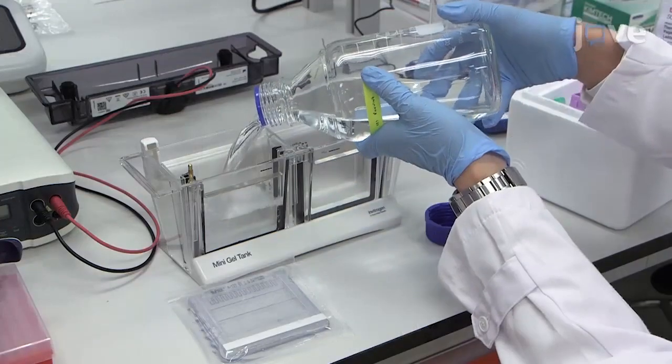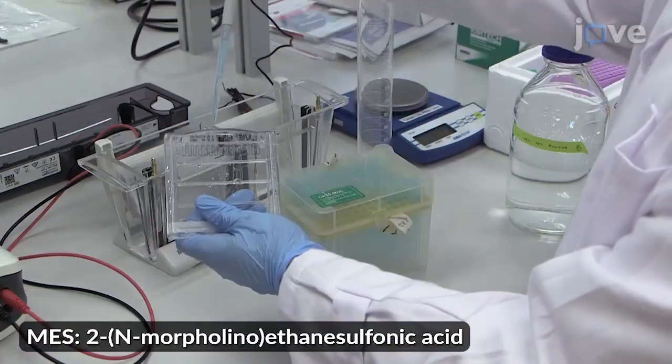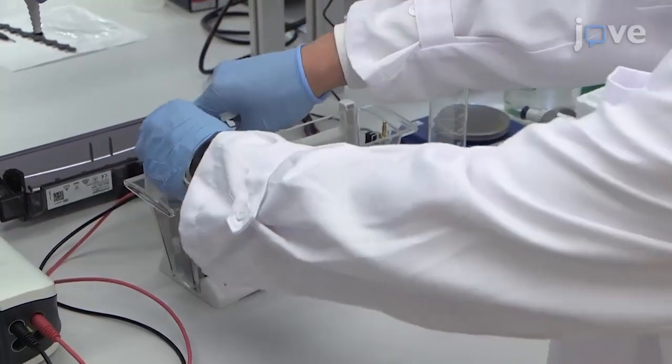Set up a mini gel tank filled with MES buffer to perform SDS-PAGE with a 4-12% Bis-Tris protein gel.